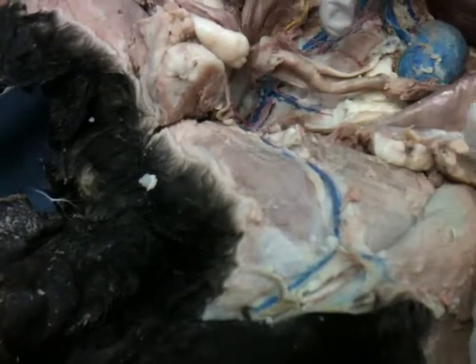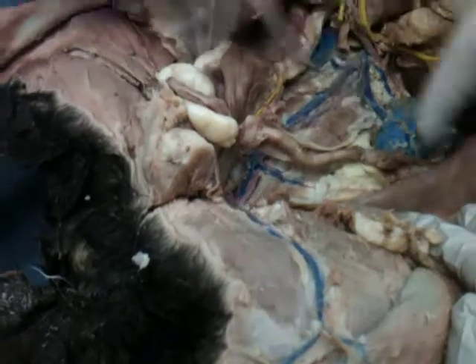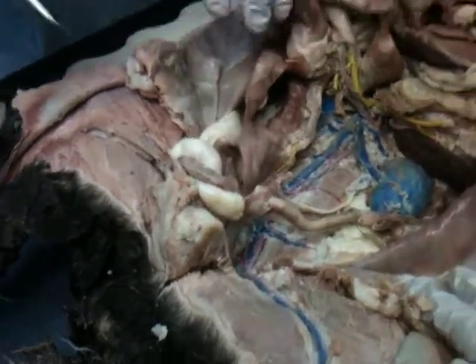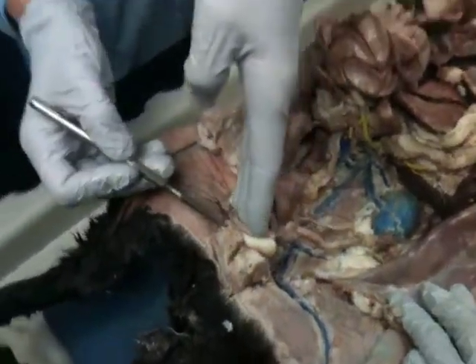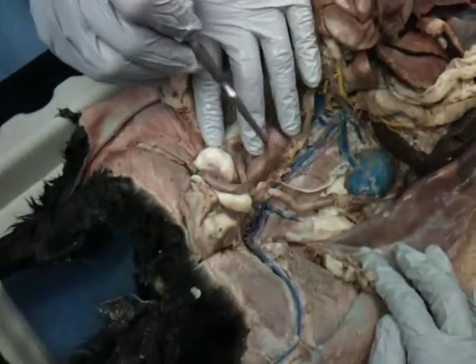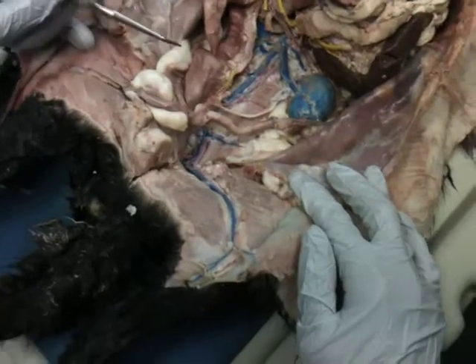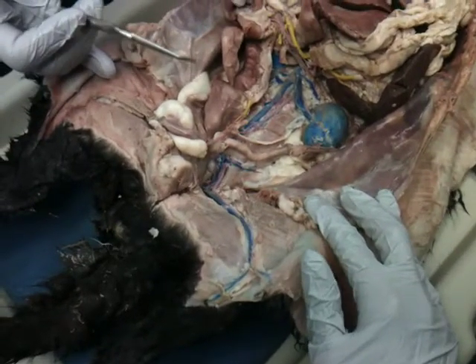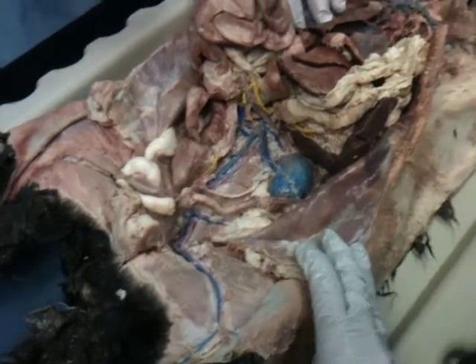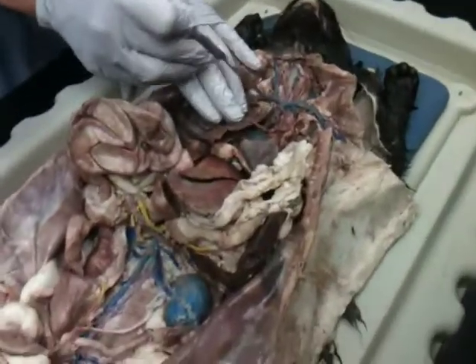A cat is different than a human in that it has two sections of the uterus with the ovaries up there and there. Okay. On many of the males, if you lift up or push down the urinary bladder, you can see the vas deferens. It's a little sperm cord, the spermatic cord. I can show you in another cat if you want. Those are the basic organs. On most of the cats, the thymus has been taken off. It's a tissue that is around this area.